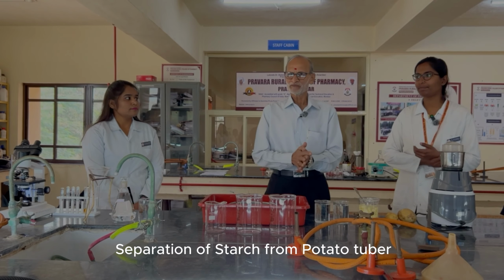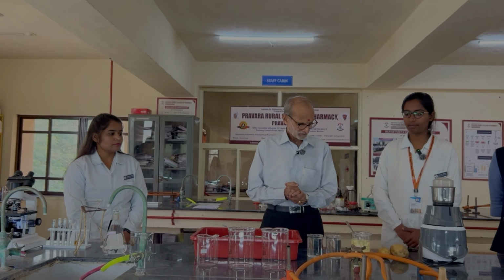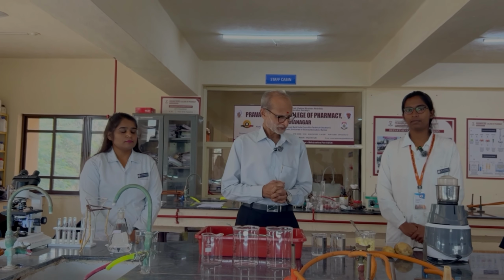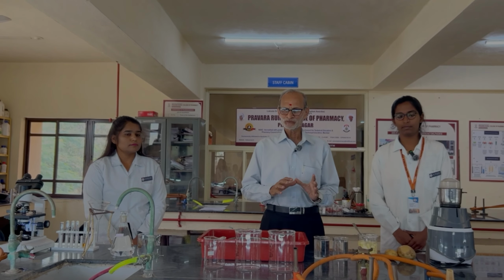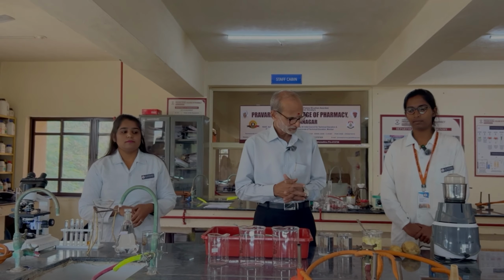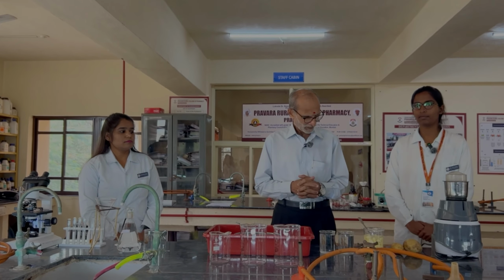We are going to begin with the very first experiment, that is separation of starch from potato. Let me give some idea about the starch. Starch is extensively used in the industry, whether it is food industry, pharmaceutical industry, textile industry, or the paper industry. So starch really has good importance in the society. And we are going to begin.